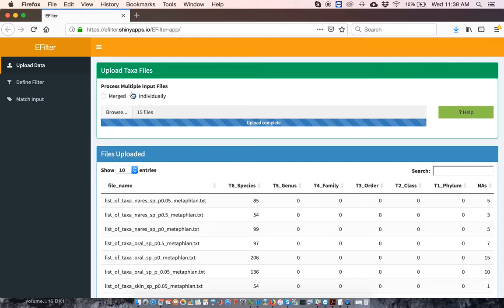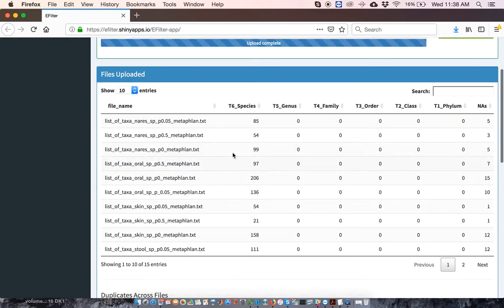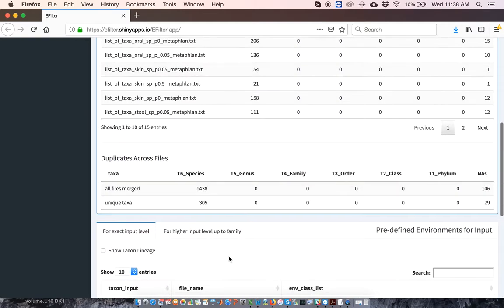The first thing that happens after you upload your files is that EFilter tells you how many distinct taxa it has found and at what taxonomic ranks. It also tells you how many taxa were not in the EFilter database. These could be bacteria that are not well defined, bacteria that were defined after the most recent EFilter update, or even taxa that are not bacteria at all. For example, they might be fungi or archaea. EFilter will ignore all taxa that it does not find in its database, so you do not need to manually curate shotgun sequencing data that might have non-bacterial organisms. EFilter presents information about taxon counts both for each individual file and for all files merged together.